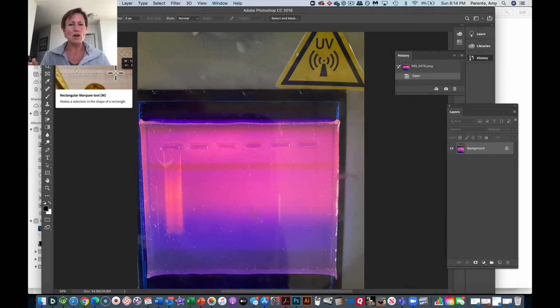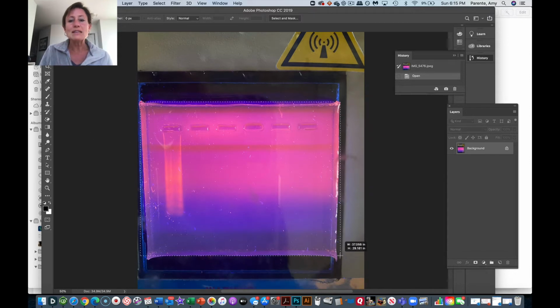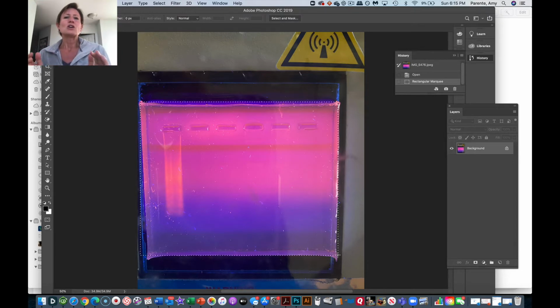So usually that involves taking two different gel images and putting them next to one another, like those two gels were run as one gel. That's a big no-no. And any manipulation that I do here, whether it's changing the intensity or anything else, I have to do to the whole gel. So I'll show you a few things that you could think about doing, but highlight again why they're wrong. So I'm going to go ahead and crop this image here.